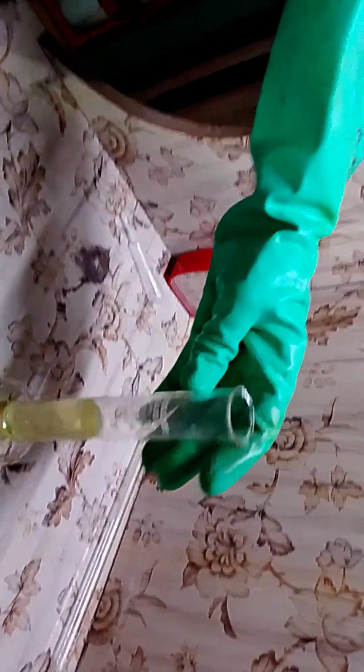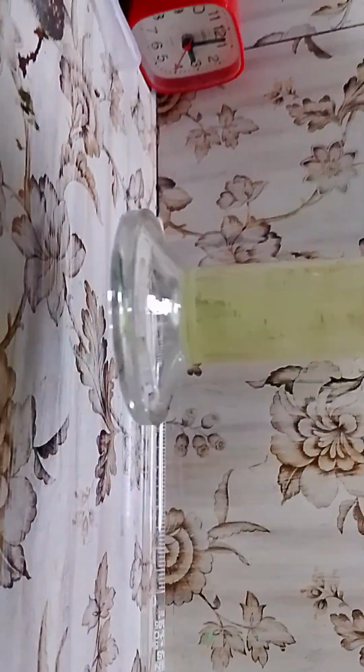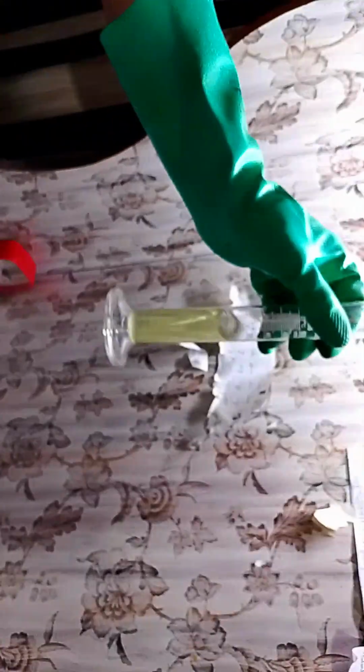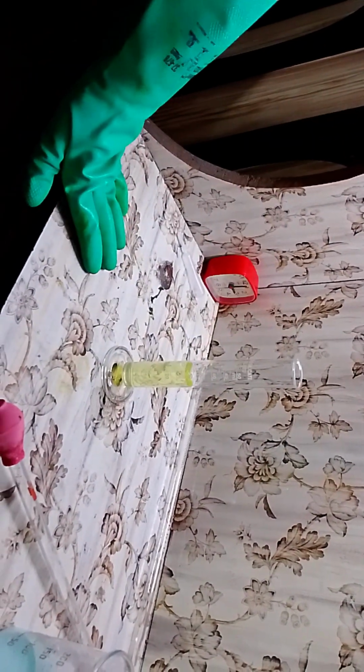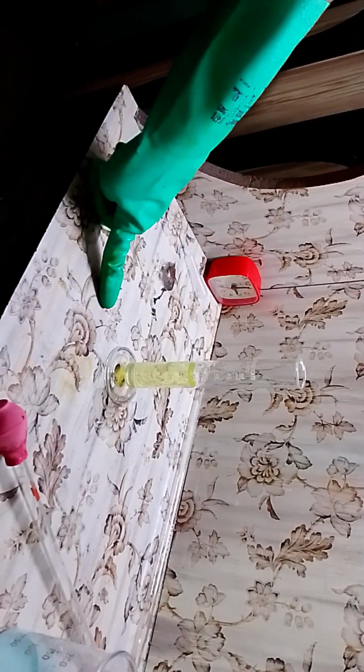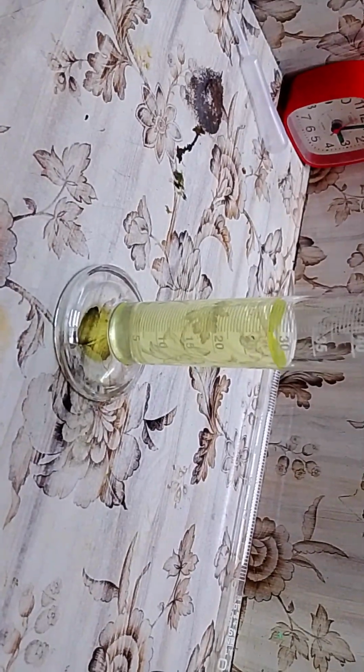Here is our sulfuric acid yield, which is around the 30 ml mark. So this is our little yellow sulfuric acid which we have obtained. Its concentration is around 30%, and we need to concentrate it to 98% because this diluteness cannot work, but still it can react with different metals, especially iron, and it can also show different signs that it is sulfuric acid. I'll show you some common signs that it is sulfuric acid.